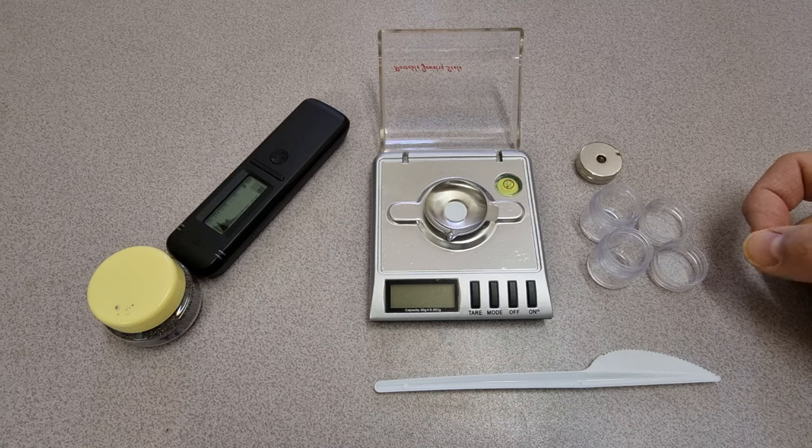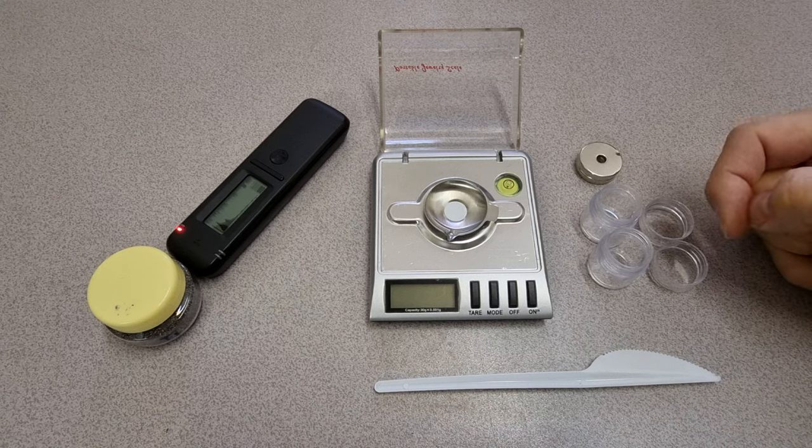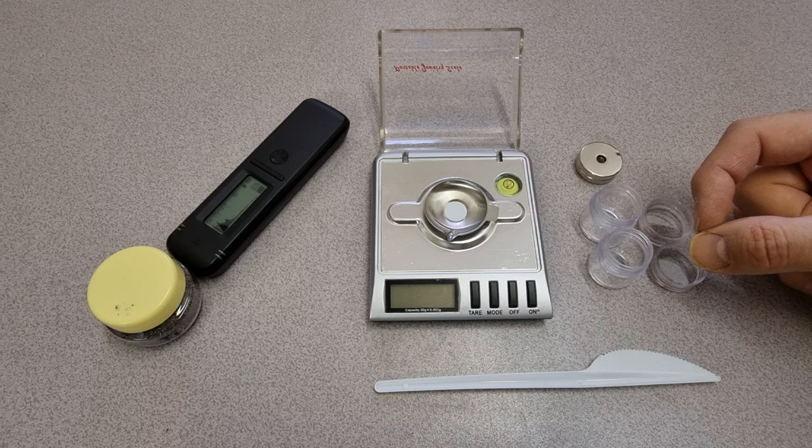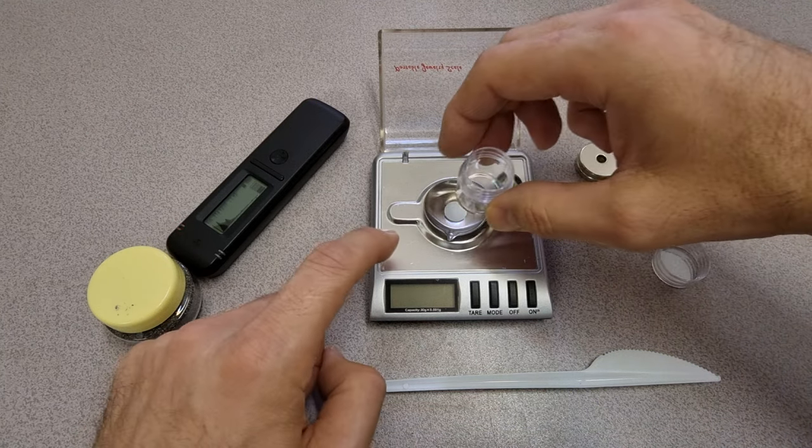What I'm going to try and do is use this magnet to separate the magnetic component from it and see if there's any difference in constitution between the magnetic component and the non-magnetic component. I'm sure there will be, so here we go.